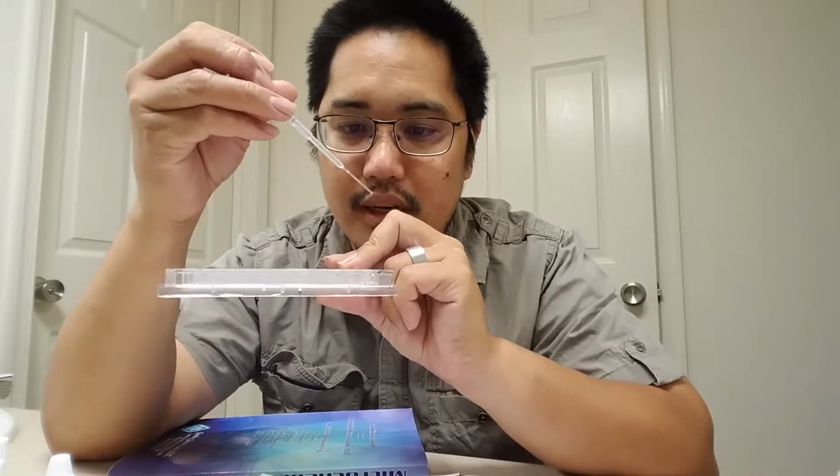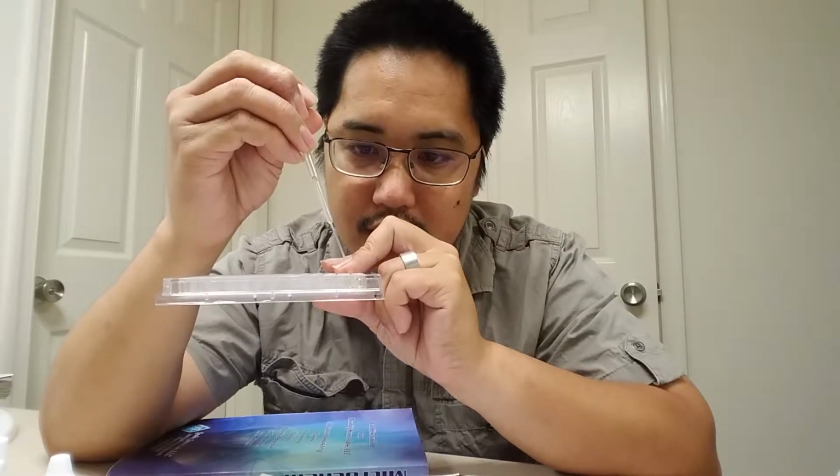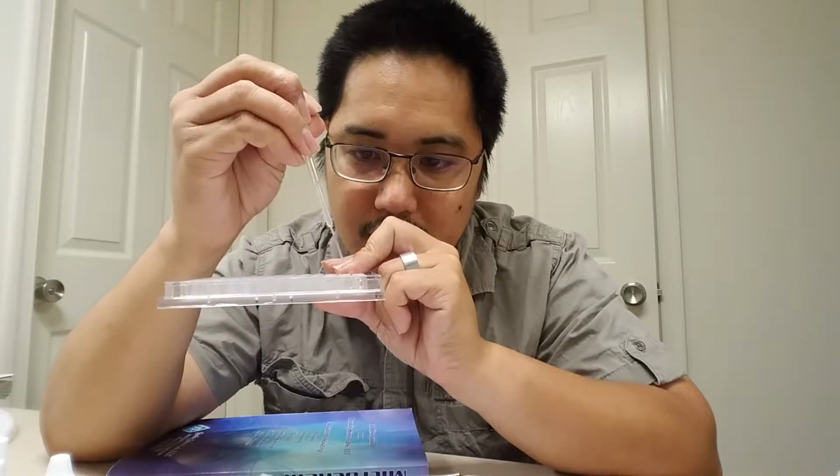Now I'm going to put 2 of these drops. 1. Oh, I didn't grab 2 of them. And 2. And I'm going to put the excess back in well number A1.